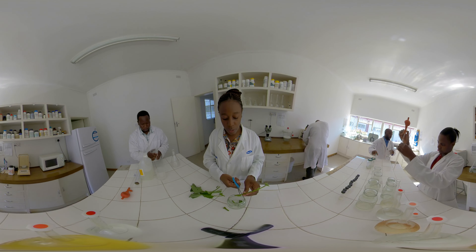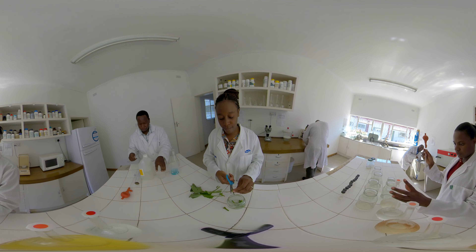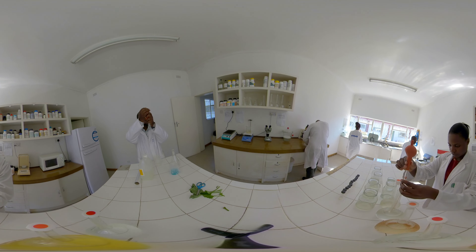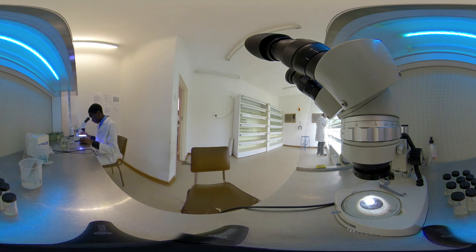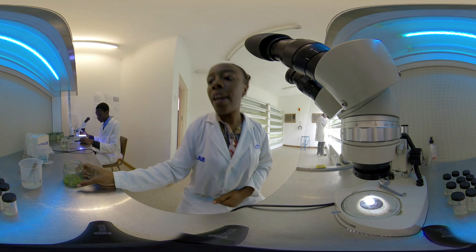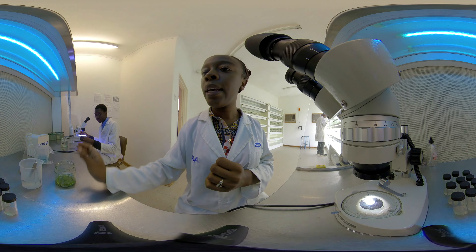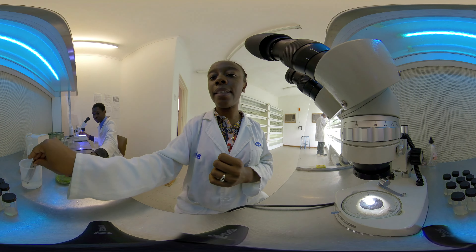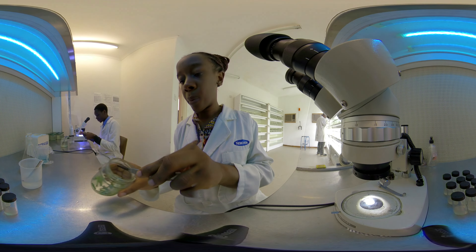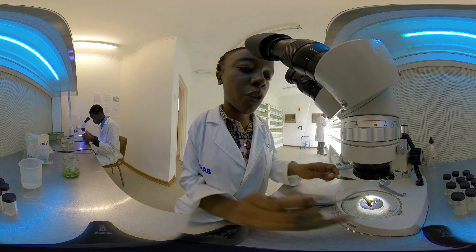This is my planting material, which I'm going to place under running water for two hours. Dennis and I are carrying out our meristem dissections. This planting material has been under running water for two hours, sterilized in a disinfectant, and has undergone three sterile washes.